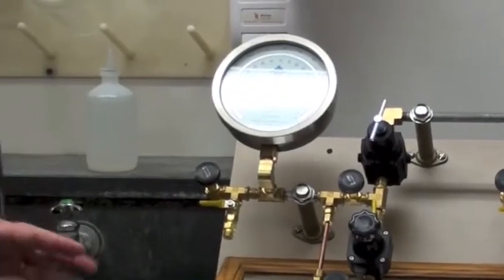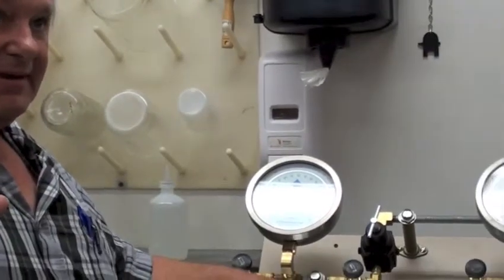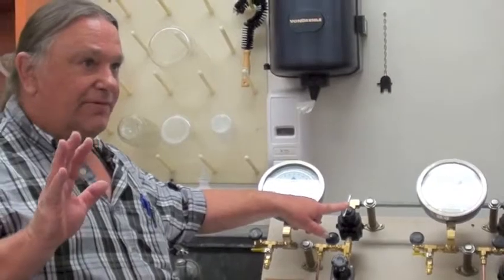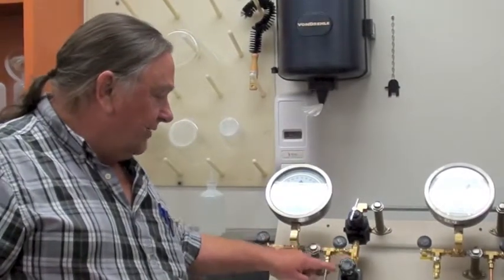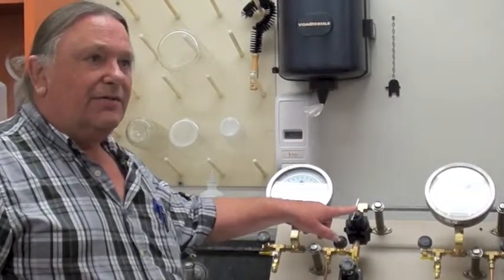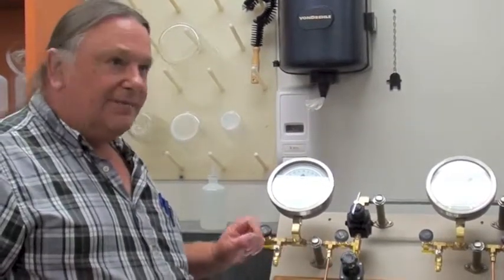Now, it's possible to do two things that will make this thing go wild and not work properly. One is, normally the Nullmatic always leaks and is very accurate from 1 psi to 5 psi. The 150 regulator is not stable below 5. So if you really don't want the leaking on the Nullmatic, you can isolate it out, turn that off, and use this regulator. But this regulator is not good below 5, so if you want to be below 5, you have to use the Nullmatic. It's also possible to make a mistake.